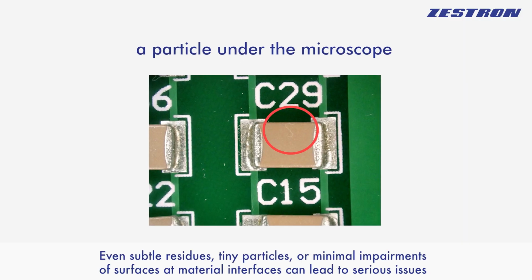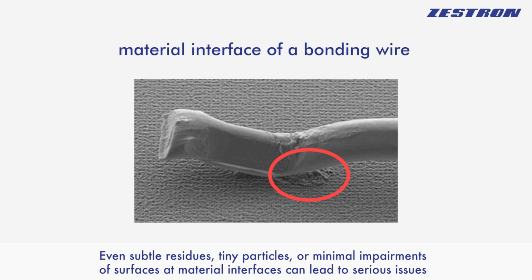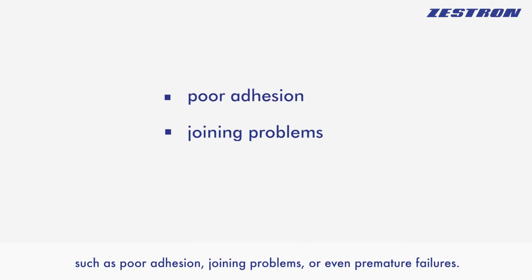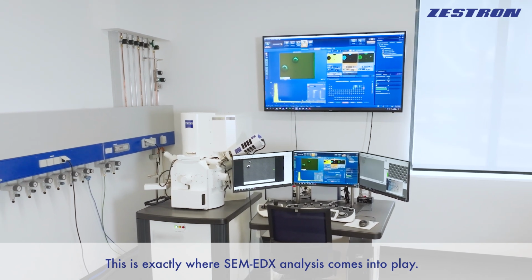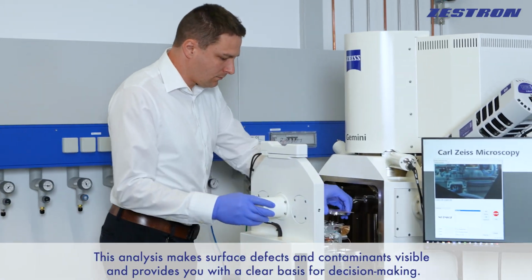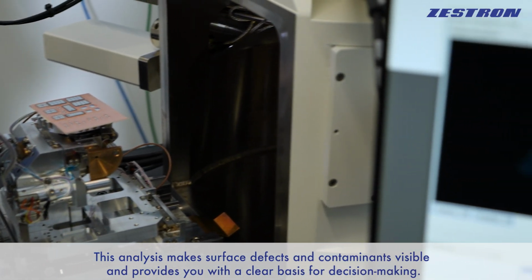Even subtle residues, tiny particles, or minimal impairments of surfaces at material interfaces can lead to serious issues such as poor adhesion, joining problems, or even premature failures. Without precise analysis, the root causes remain hidden. This is exactly where SEM EDX analysis comes into play. This analysis makes surface defects and contaminants visible and provides you with a clear basis for decision-making.